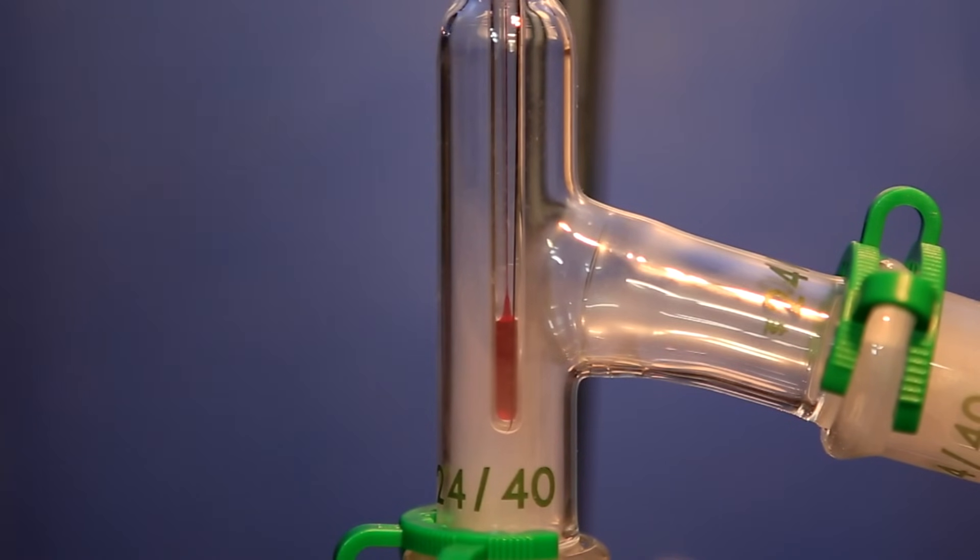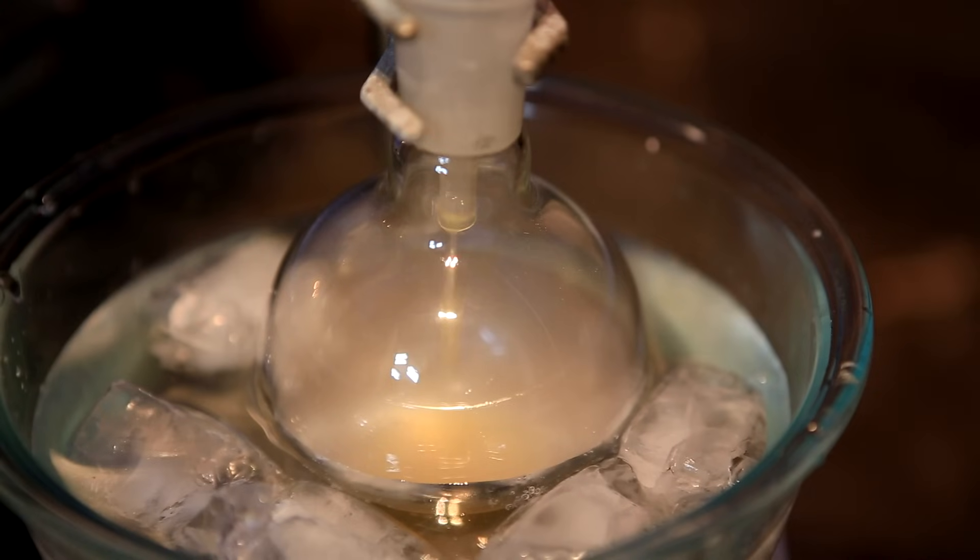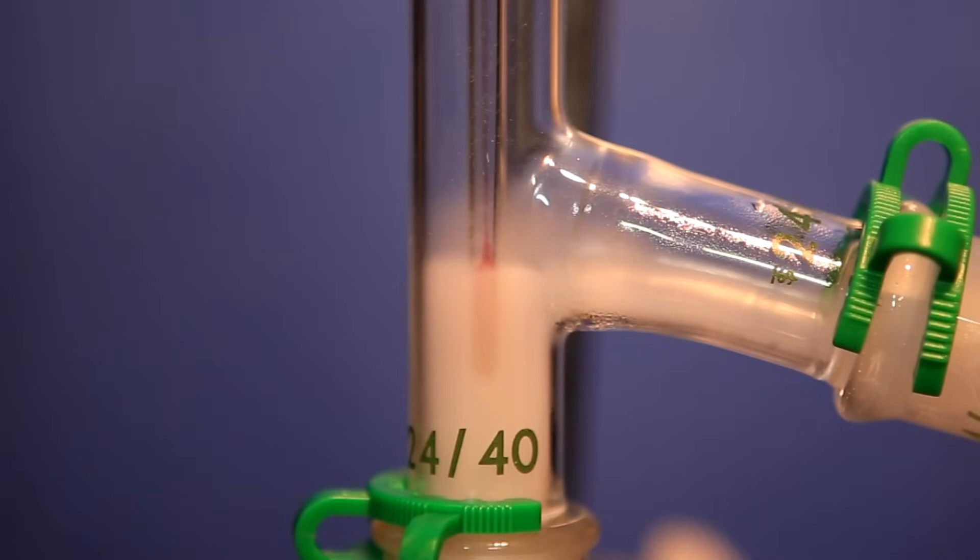Eventually white vapor was seen. Soon after the appearance of the white vapor, some yellow cloudy distillate started coming over. As the distillation progressed the vapor got thicker and thicker.